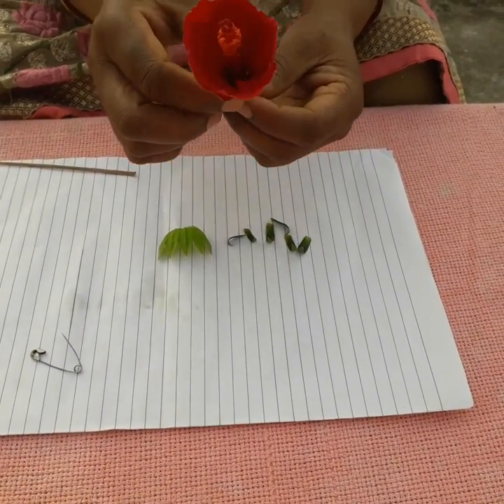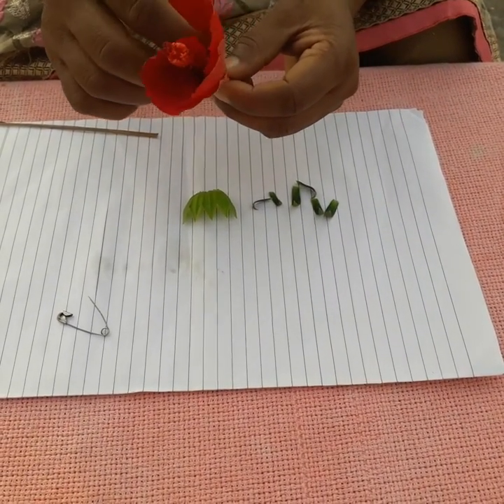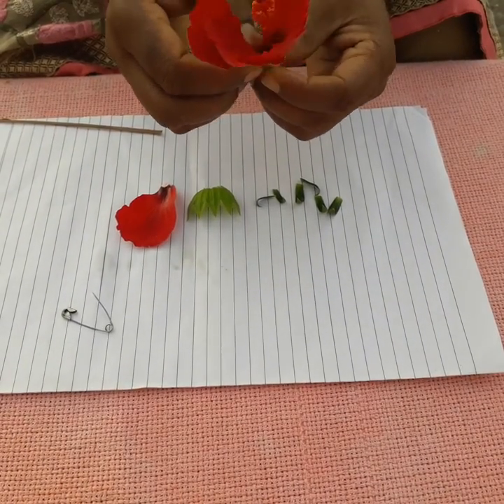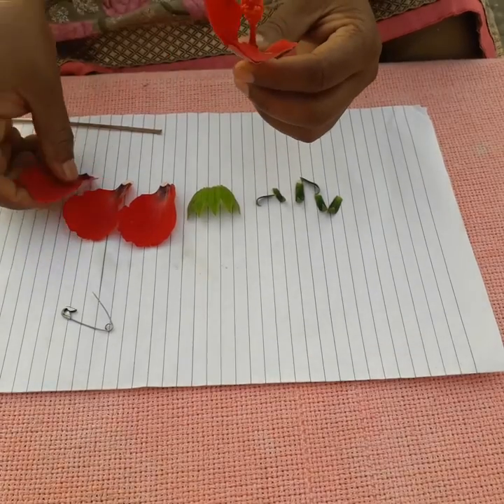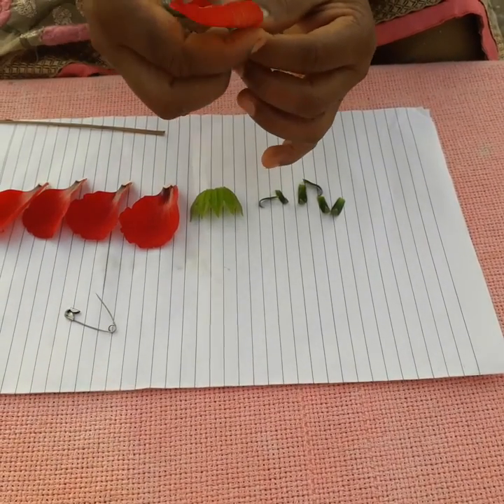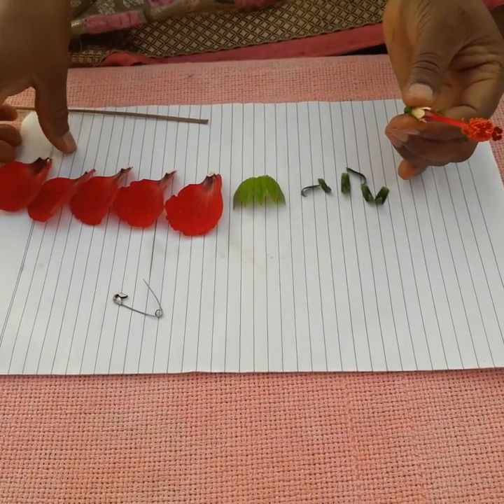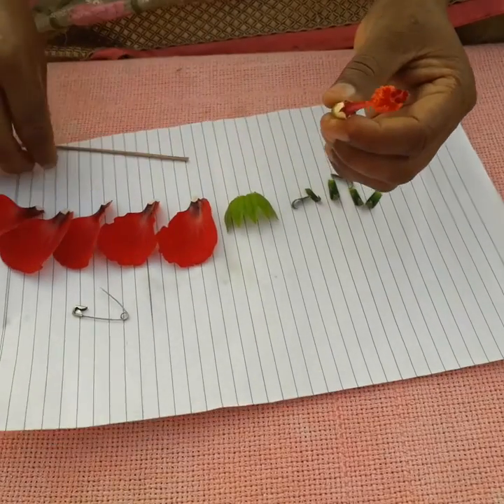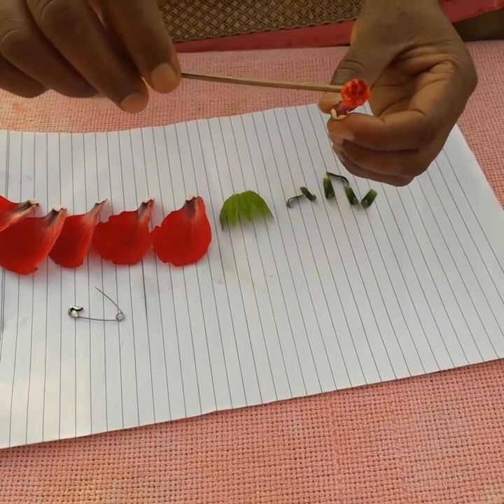The second whorl is the attractive part — that is the colorful petal. The petals are also five in number. This is the second whorl, also known as corolla.